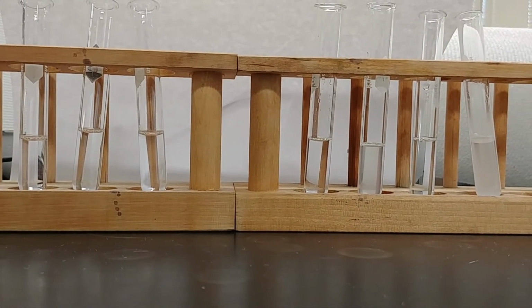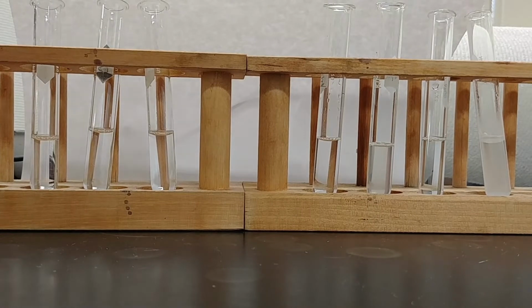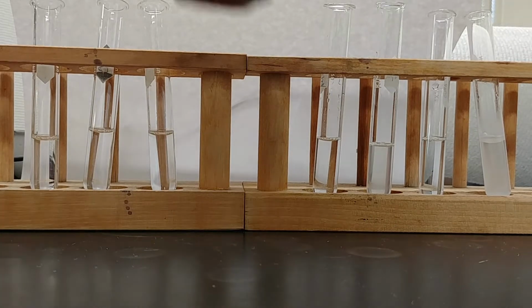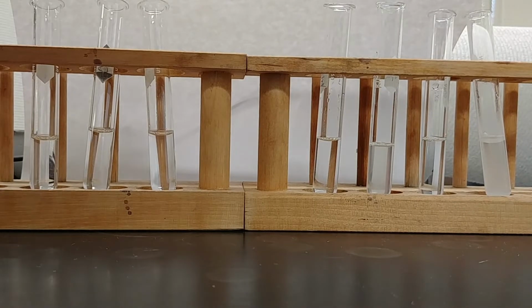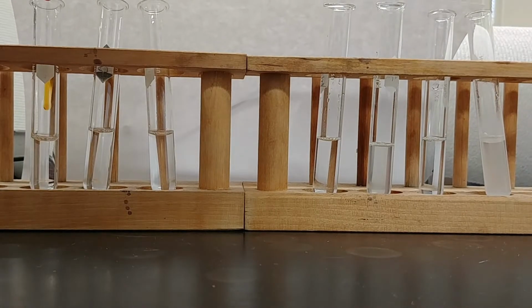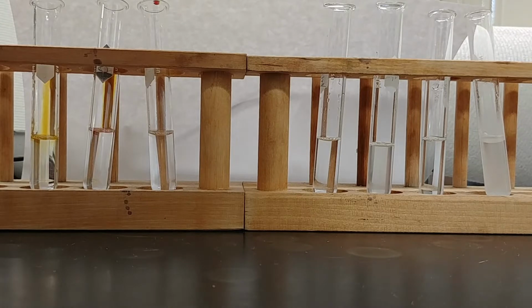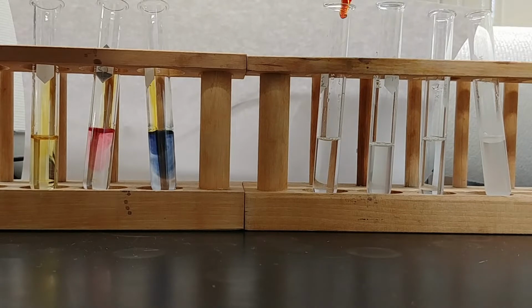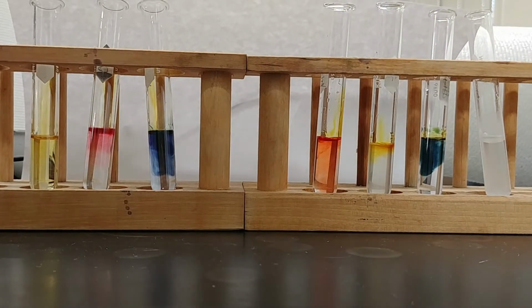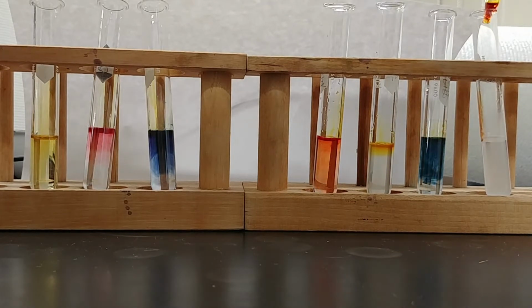Okay, we have our 7 solutions, again in order, the sodium chloride, HCl, and sodium hydroxide, and so on. We are going to add a little bit of the universal indicator to each of these solutions. A little dab will do you here. We just do a single drop in each of our test tubes. The universal indicator will change color in response to the pH of these solutions, and we can use that color to gauge the pH of these solutions.